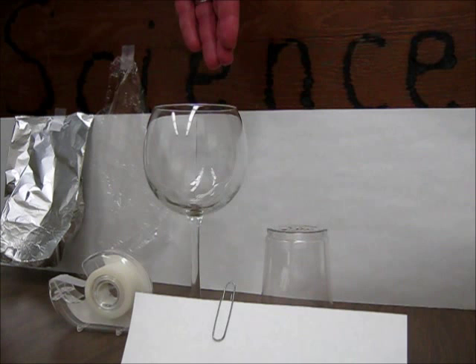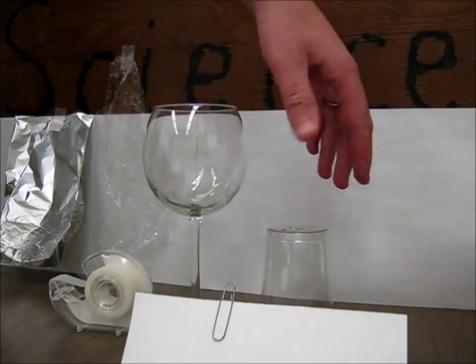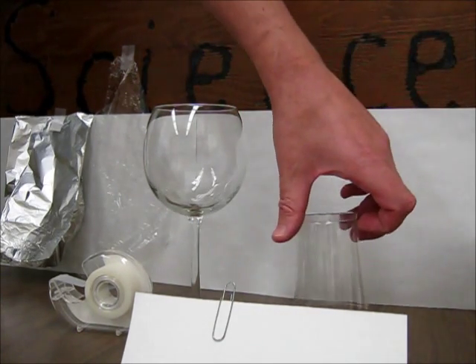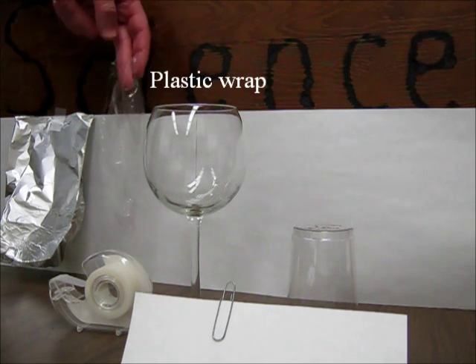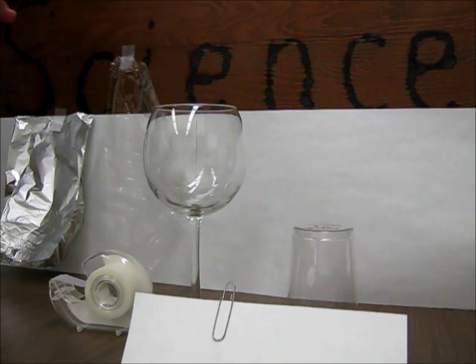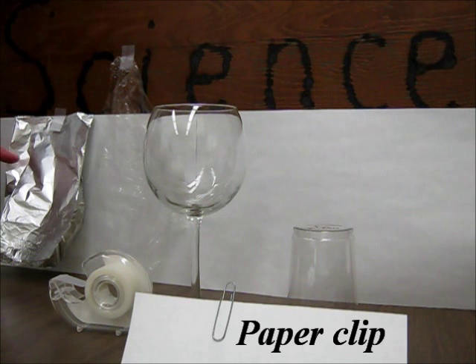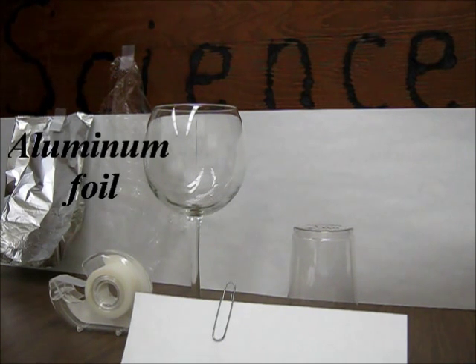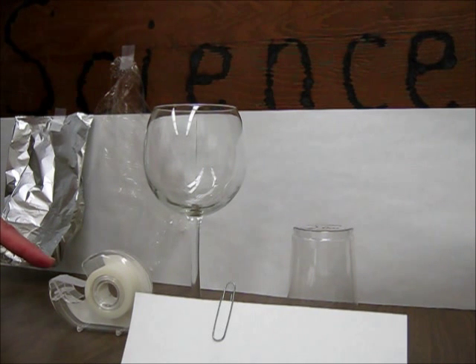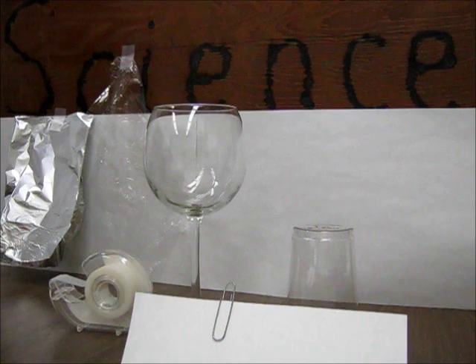What we need for this is some kind of glass, some kind of clear container. I like this fancy, pretty-looking wine glass. You can use a simple plastic cup. Some plastic wrap from the kitchen, or even paper, something to serve as a cover. And the main pieces of our electroscope will be a paper clip and, again from the kitchen, some cheap aluminum foil. And really, the cheap thin stuff is the good stuff. Use some tape to put things together. And there are some tools we could use. A nice pair of pliers are sometimes useful.